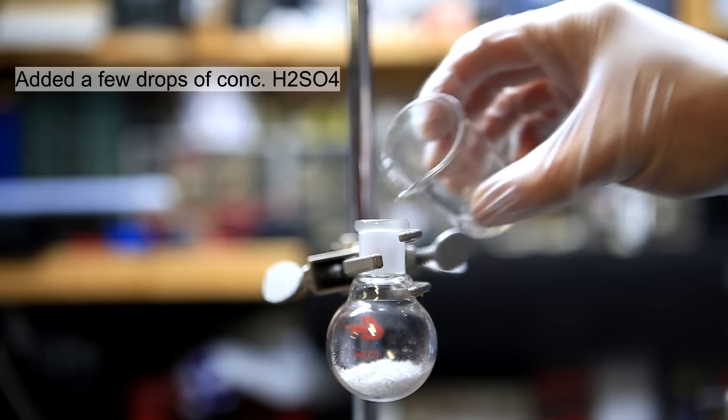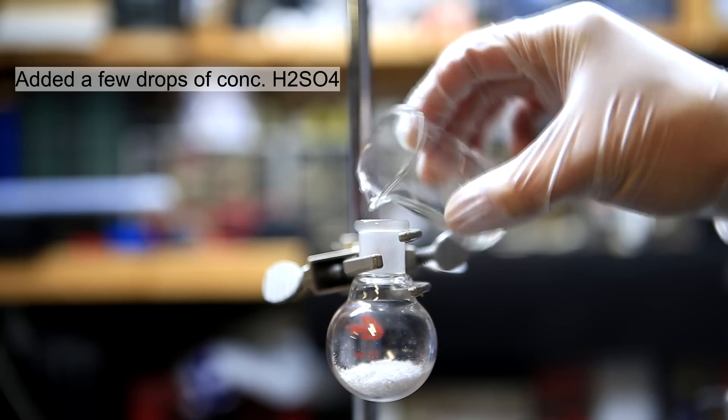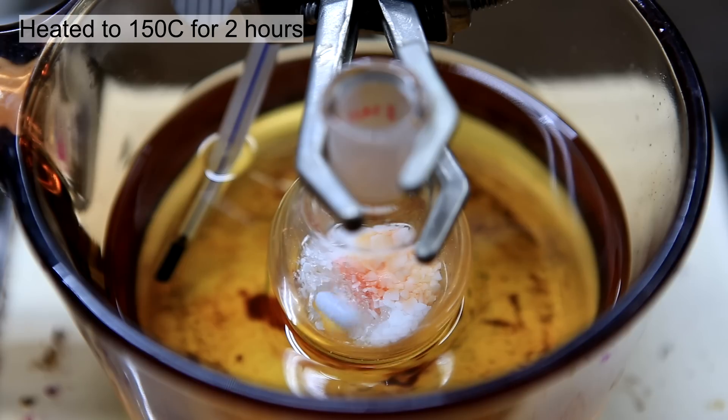Then, using a beaker, a few drops of concentrated sulfuric acid was added. The mixture is then heated to 150 degrees Celsius for 2 hours.